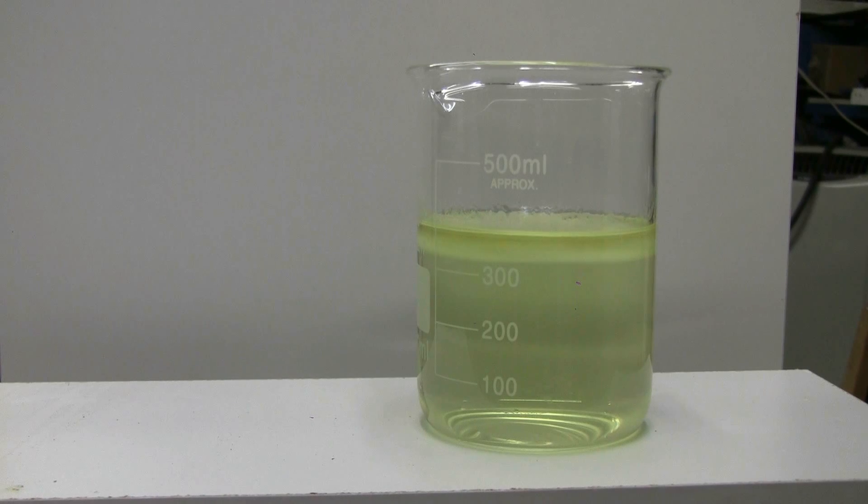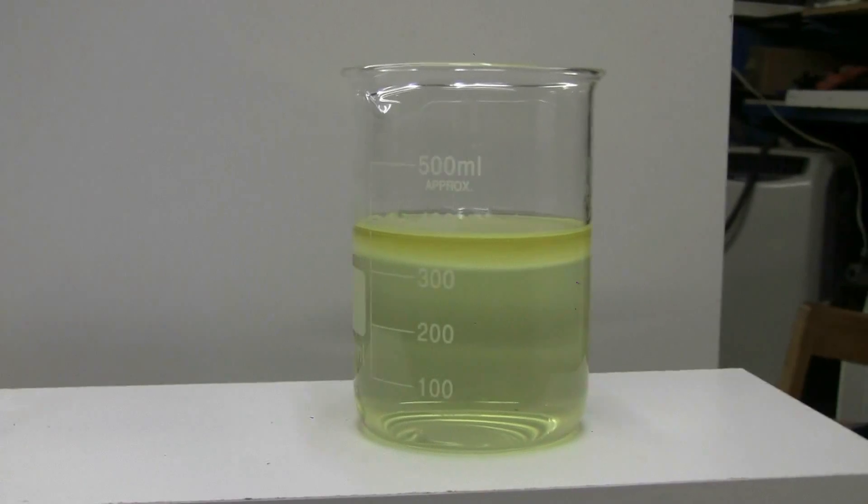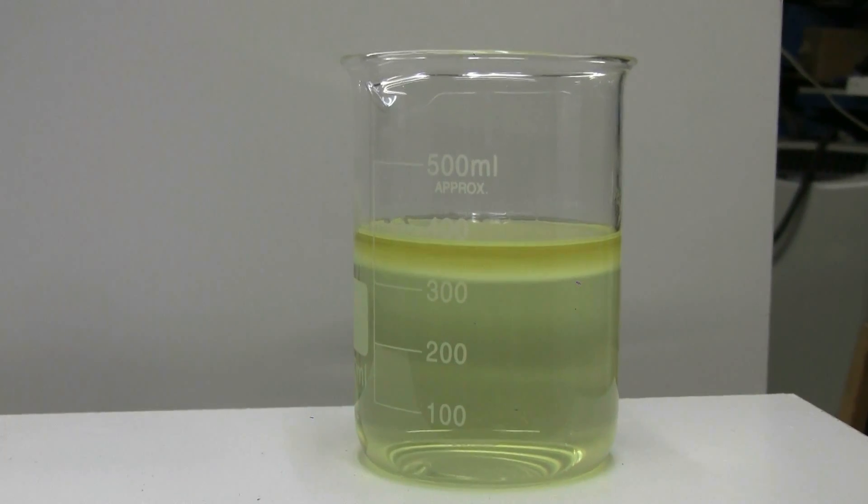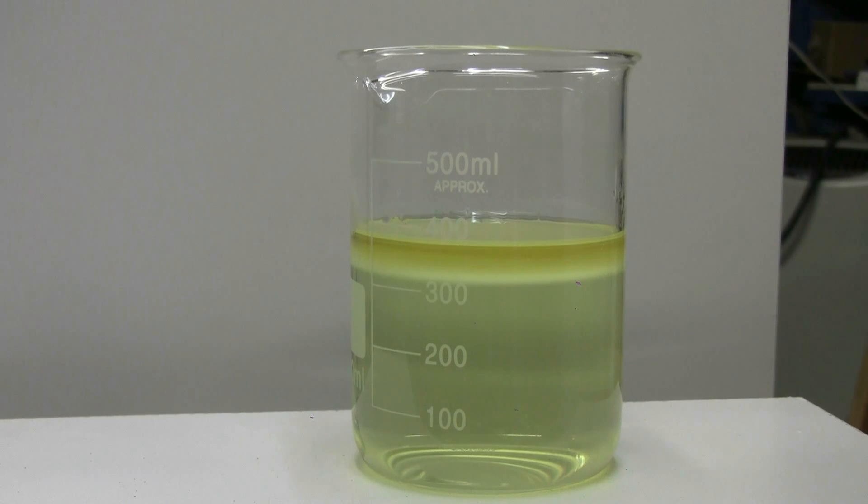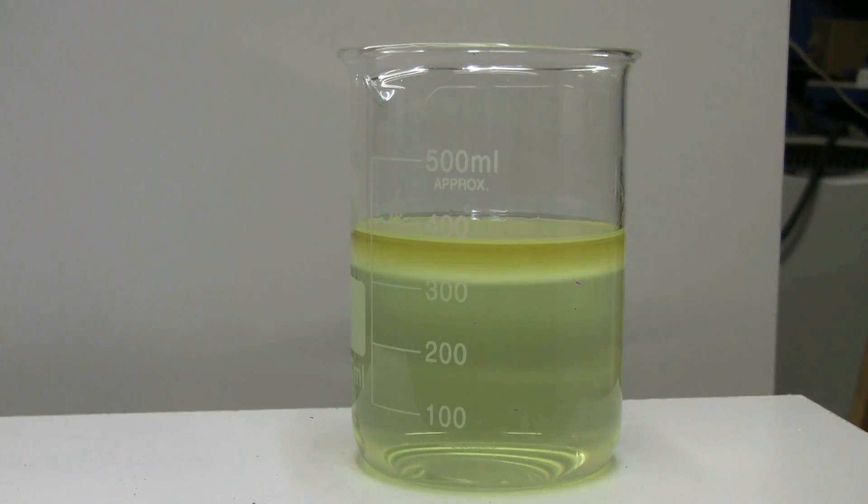Adding about 10 milliliters, we can see a layer forms on top as the reaction starts. There's a little bubbling. Chloroform will be formed. I'm going to stir this a little bit now with a glass rod.